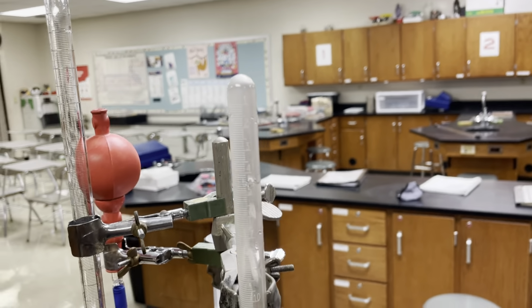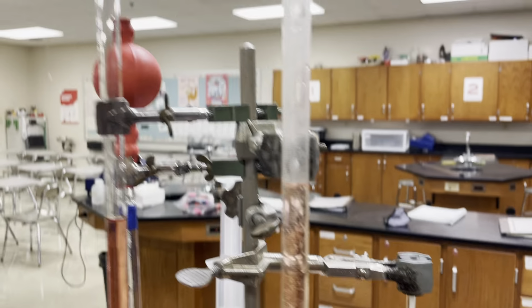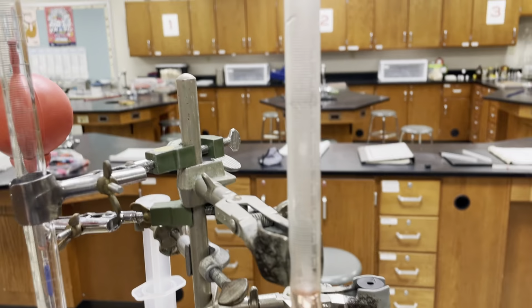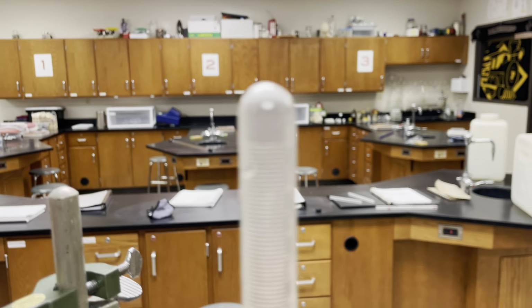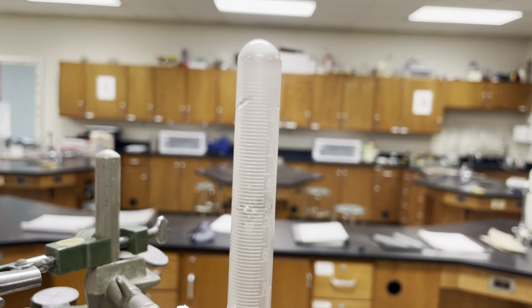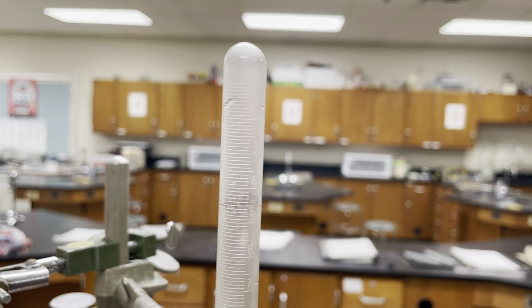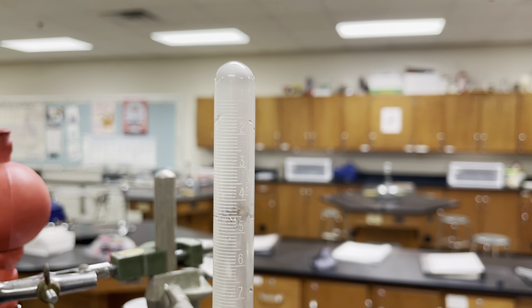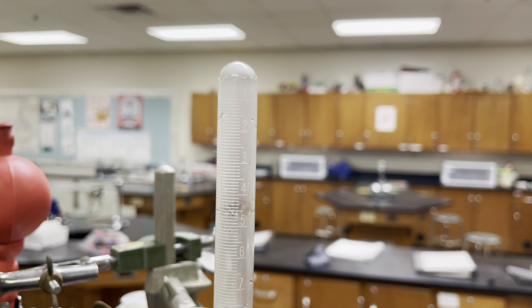Okay, now I'm not sure I'm going to be able to get this to focus well enough. I'm going to have to get up on the table a little bit. The inside is kind of foggy and the lines are white, so it's probably not going to come out very well in the video. Ooh, okay, I might have hit the sweet spot there. Hopefully you can kind of tell that this has numbers counting down also.